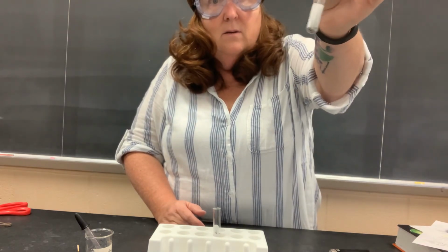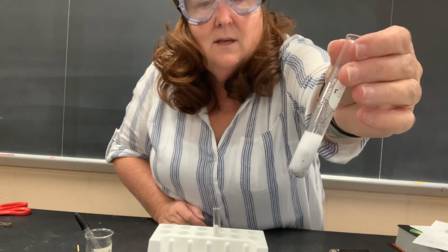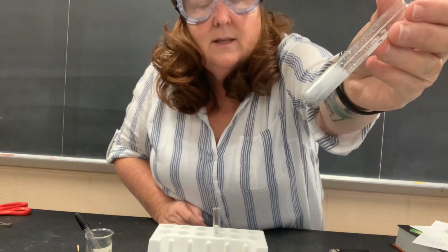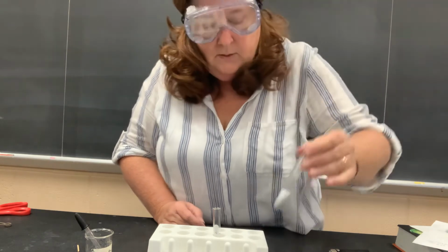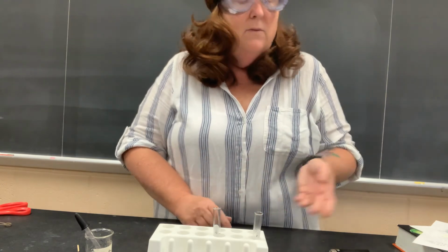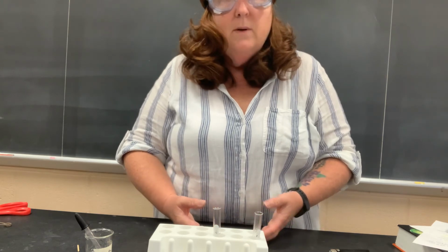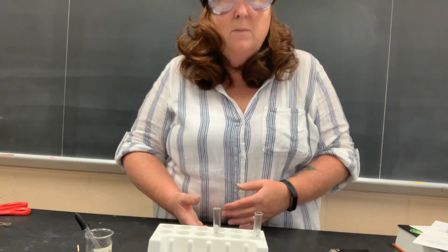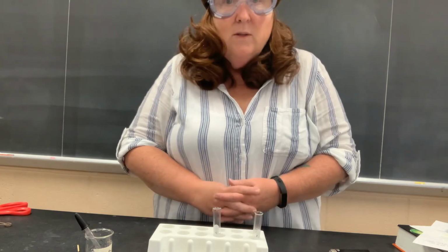You can see in there, I think, if I get it closer. Gas is given off. Doesn't really look like that silver metal anymore. It appears to disappear. So that's a chemical property. Reactivity with acids, reactivity with bases, flammability, those are all chemical properties and a chemical change occurs. Physical properties are things like color and luster and malleability and ductility. Those are things that once you measure them, they don't change what the substance is.